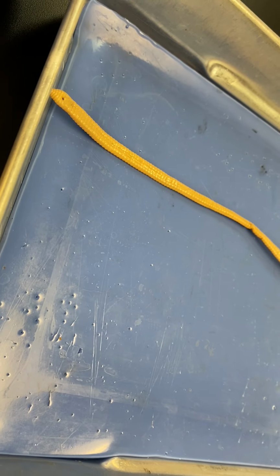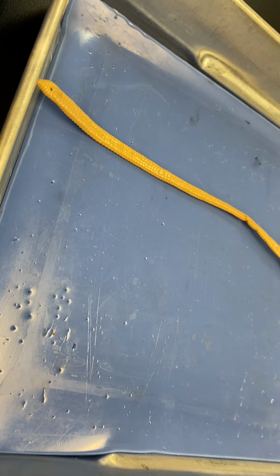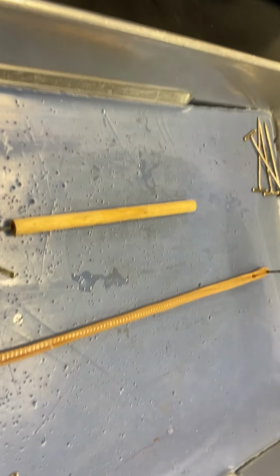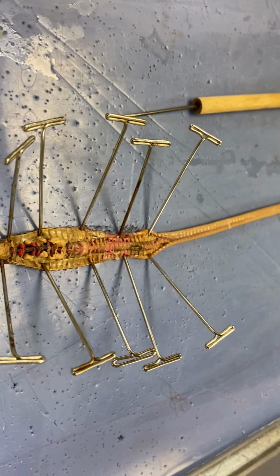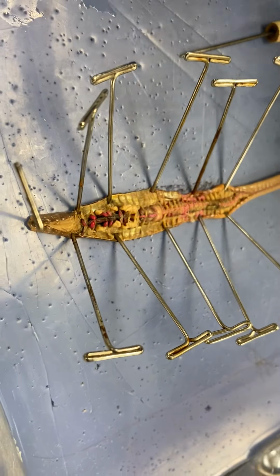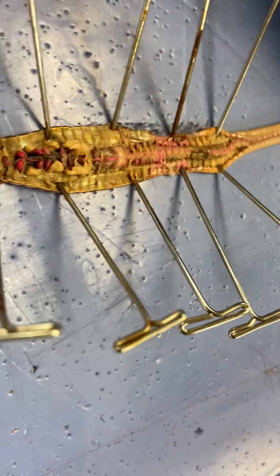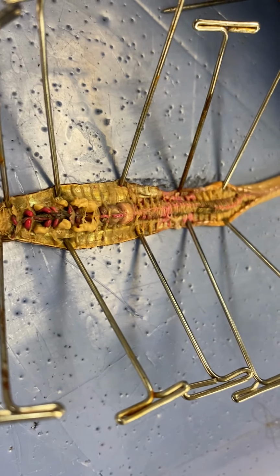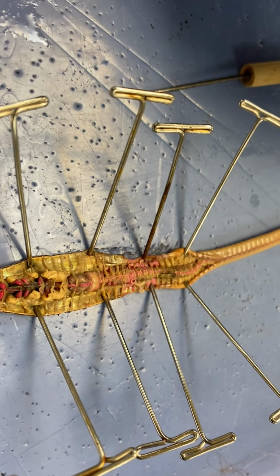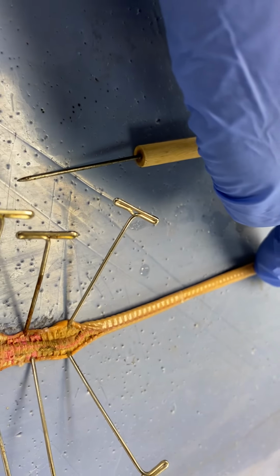You won't be able to see them unless you look under the microscope, but the setae help it grip a surface, like the soil, and anchor it while it moves. There are also two types of muscles in the earthworm, the circular and longitudinal muscles, that help it contract and expand when it moves. But you can't see those muscles. So you have the setae on the underside, and you have the metameres, the segments.